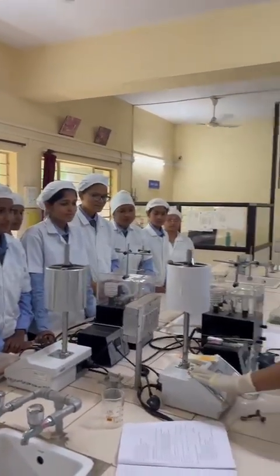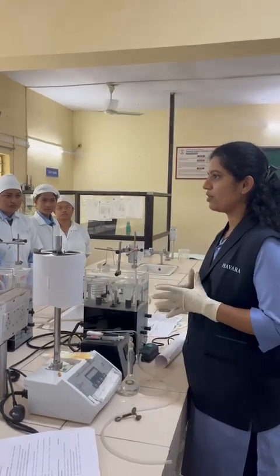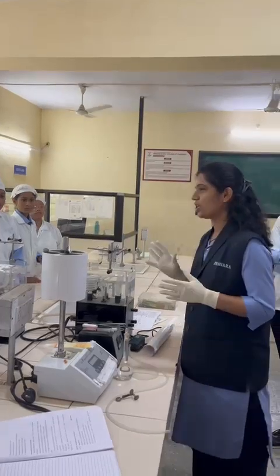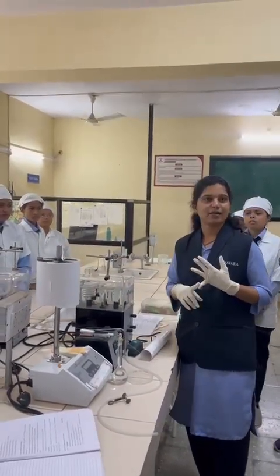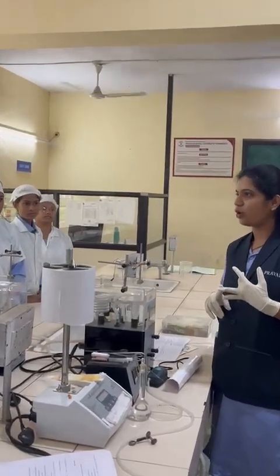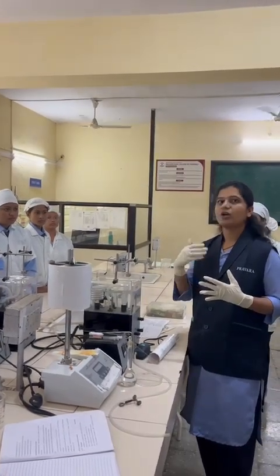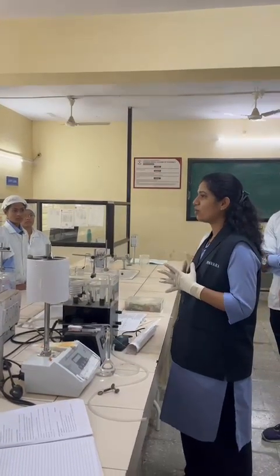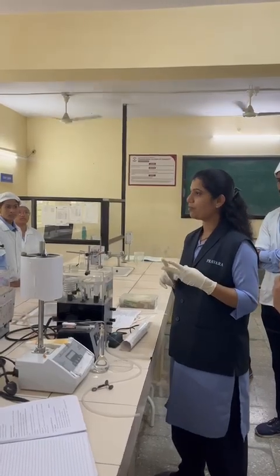Okay. So for the measurement of bioassay of any drug response, we have to take the bioassay of that particular drug on a tissue. Here we are using various types of tissue. First there will be the rectus part of the frog. Second will be the ileum part of rat or chicken ileum. And third will be the heart part or the goat trachea. Likewise, in the lab mode we are using the goat trachea. Second is chicken ileum or rat ileum.